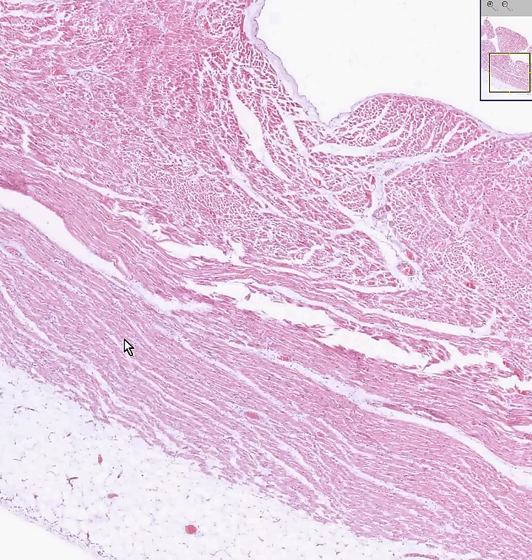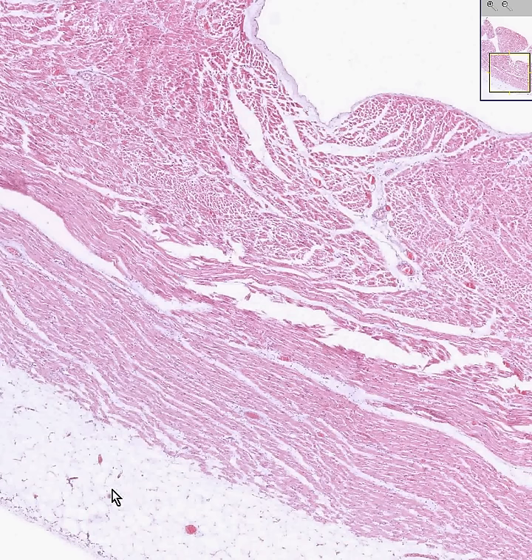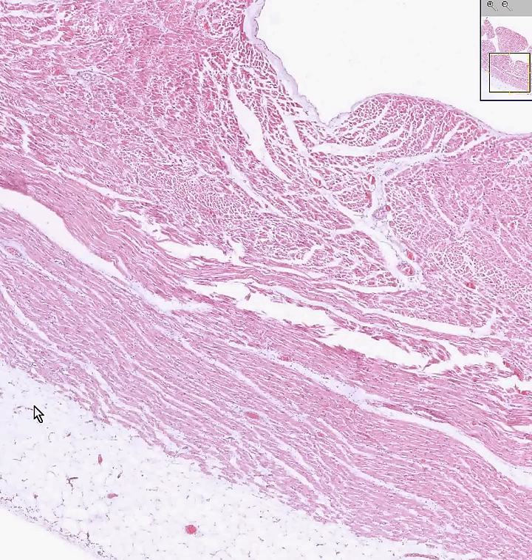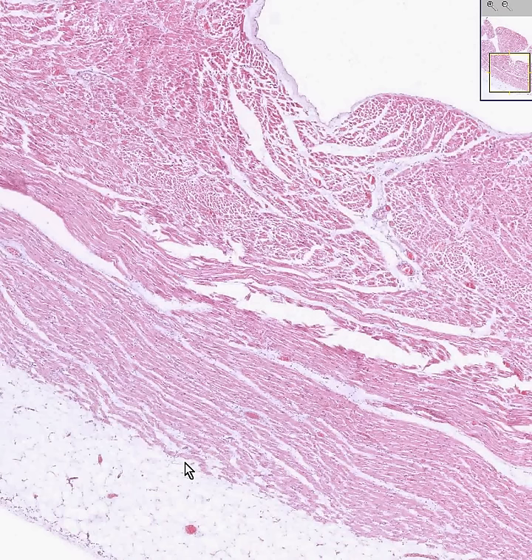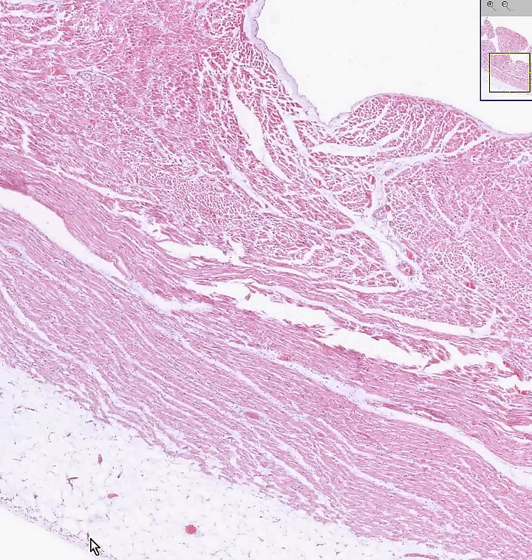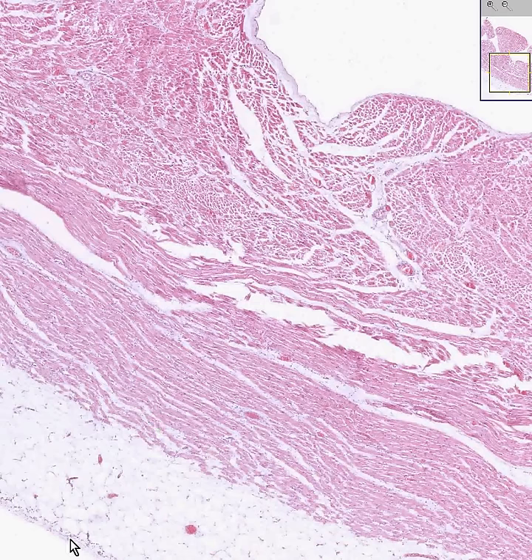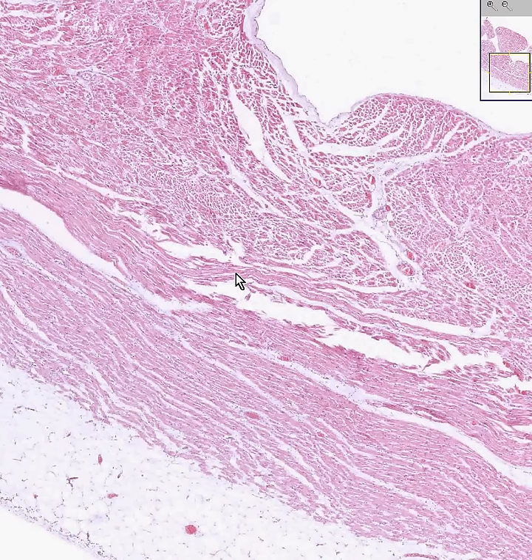The heart follows the classical pattern of inner lining, middle lining, and outer lining. In blood vessels we call these the intima, media, and adventitia. In the heart they are called endocardium, myocardium, and pericardium — specifically the visceral pericardium, which is adherent to the heart itself, as opposed to the more fibrous parietal pericardium, which is the fibrous bag in which the heart sits.